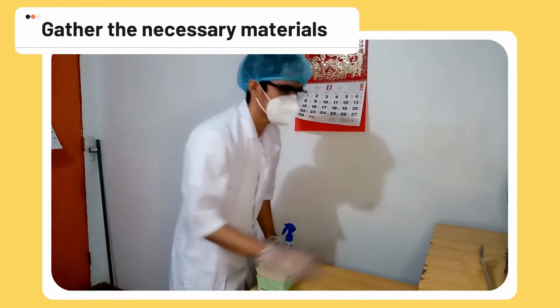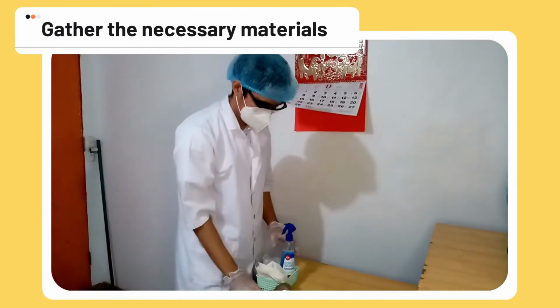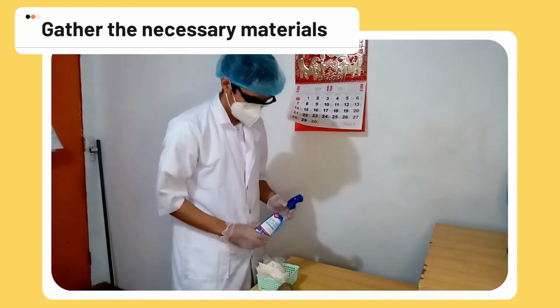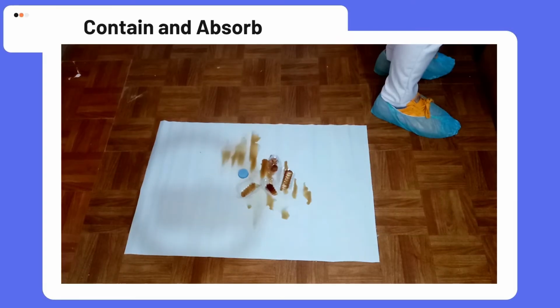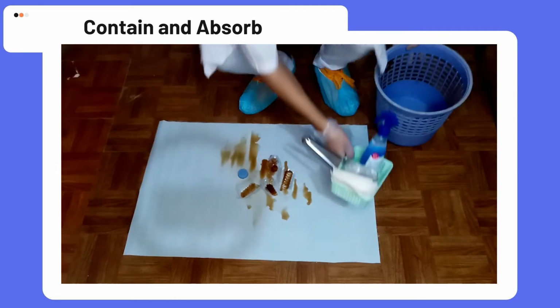After acquiring your PPE, the next step is to gather the necessary materials in order to clean up the spill. This is the spill kit and the tongs and other necessary materials. Before handling the spill, read the materials data sheet for proper analysis of the spilled chemical and the proper procedures of chemical decontamination. Step 4 is to contain and absorb.